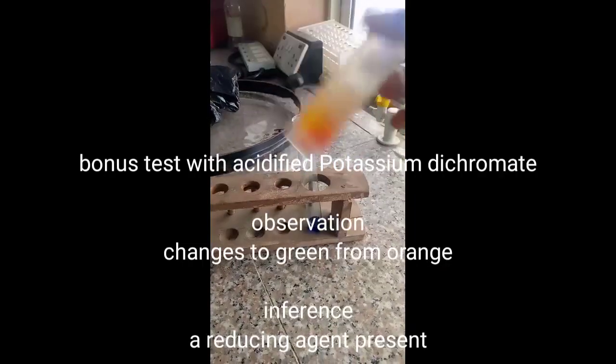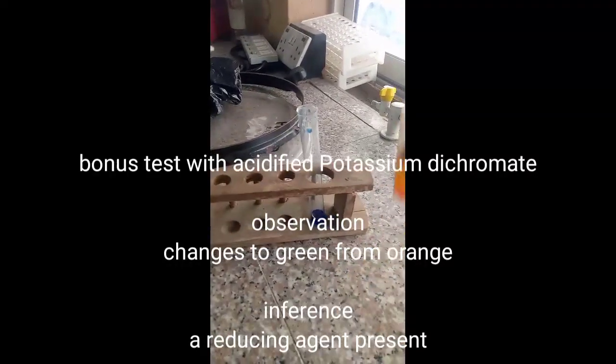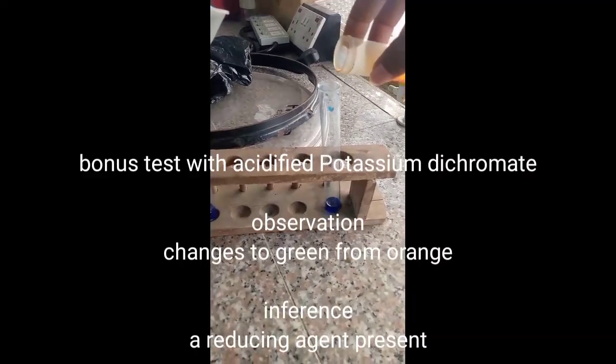This is potassium dichromate, and this is the solution. Okay, therefore we are going to have a color change.